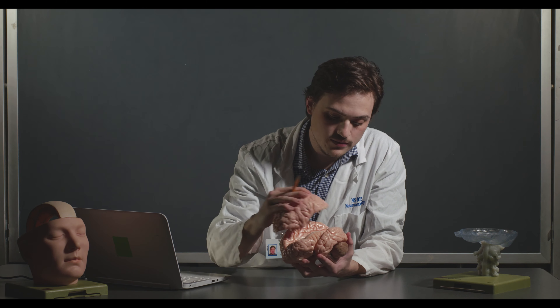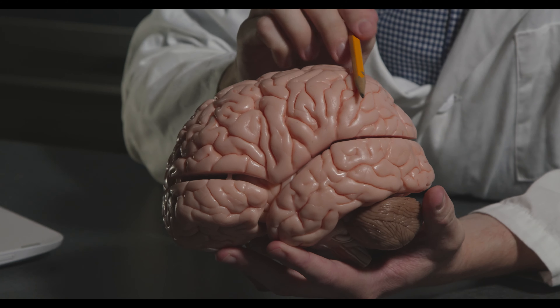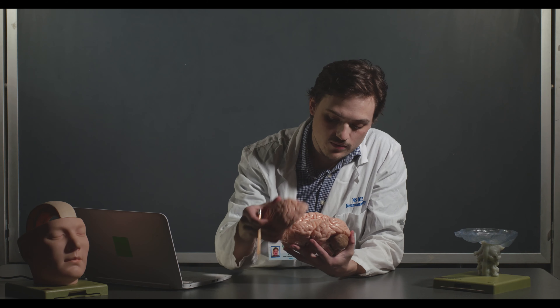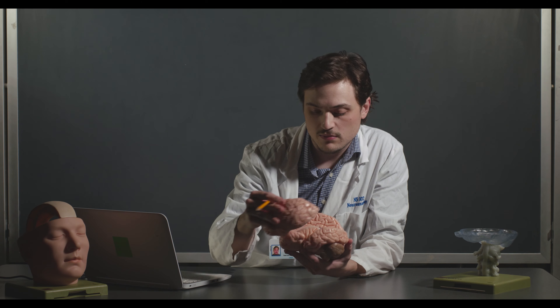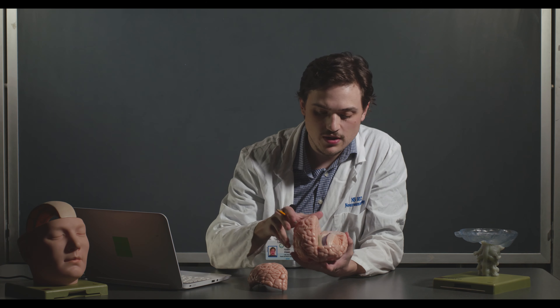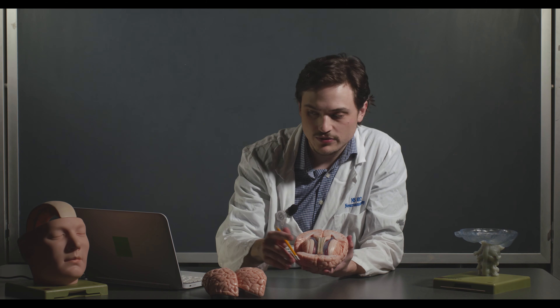The major lobes — frontal, parietal, occipital in the back which is largely involved in vision, and the temporal lobe. There's also the limbic lobe, which is harder to see on this model and usually hugs around the corpus callosum. We'll cover all of these more extensively in subsequent labs and lectures, but they're also in your lab manual for reference.